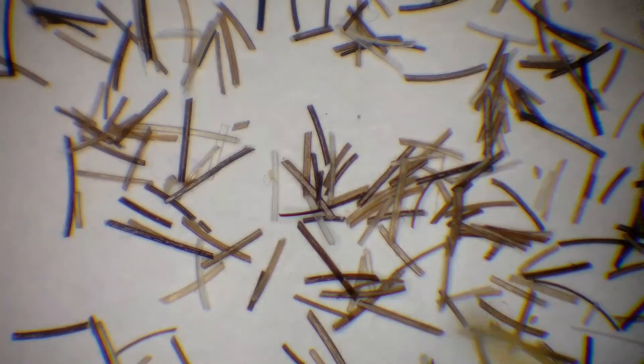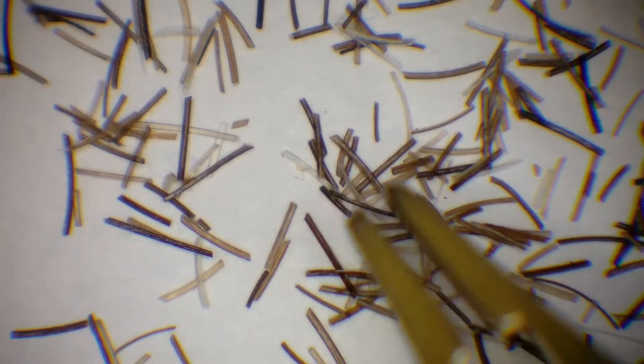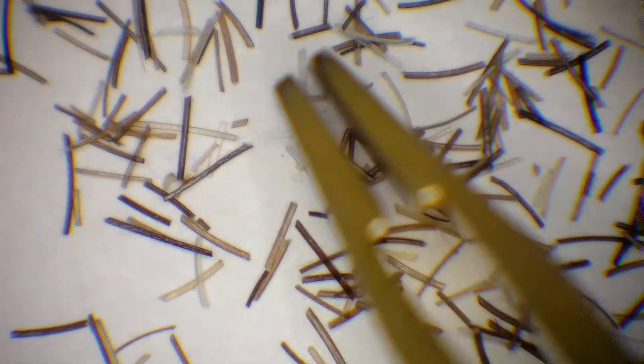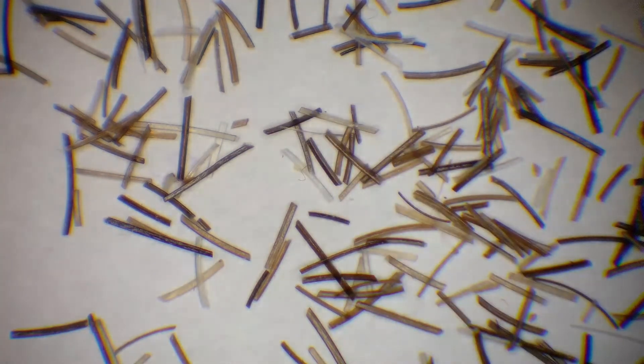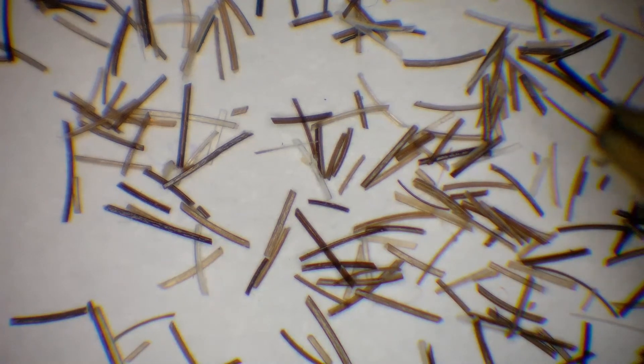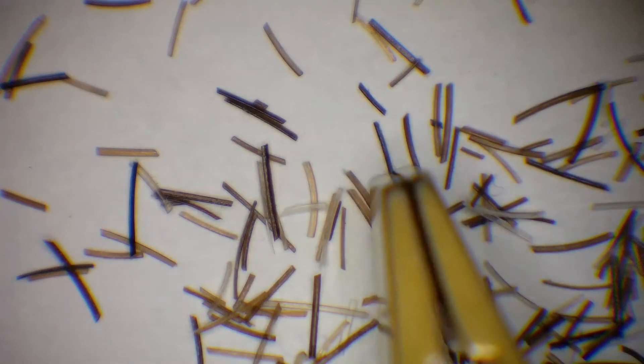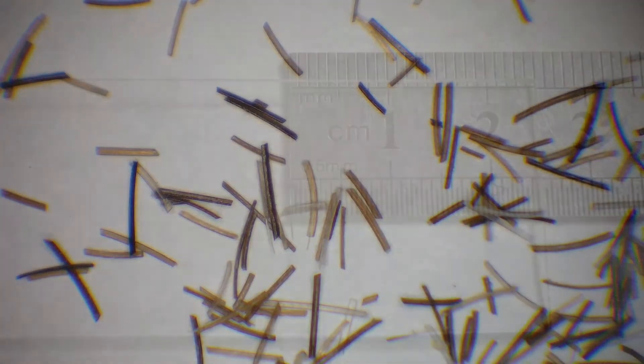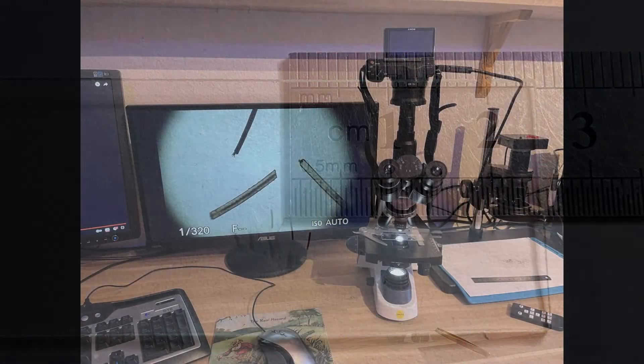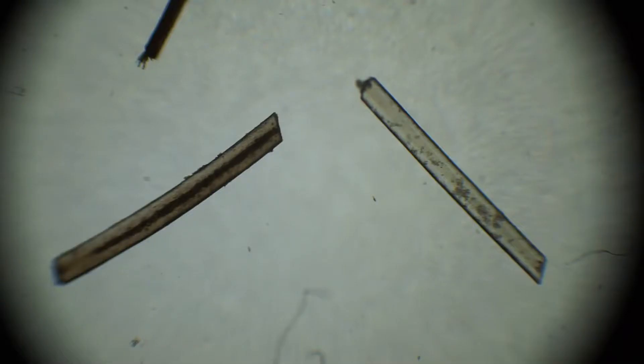So I will just pick out one of each color. I think I'll start with one white or that looks like glass, hard to get, and we take a light brown and here is a black one or maybe dark brown. I don't remember. Take one of the other one also. Then here we have four pieces ready for next step, the real microscope, the Swift 380T.